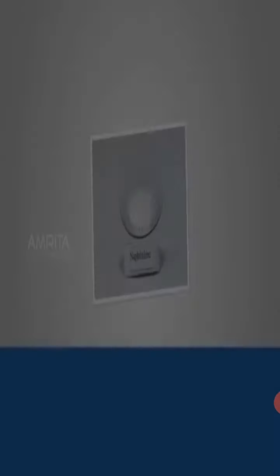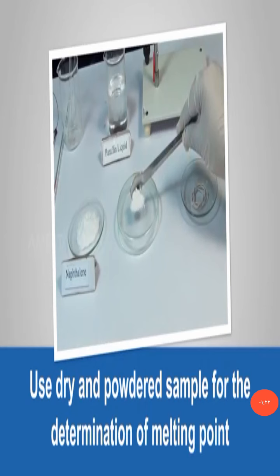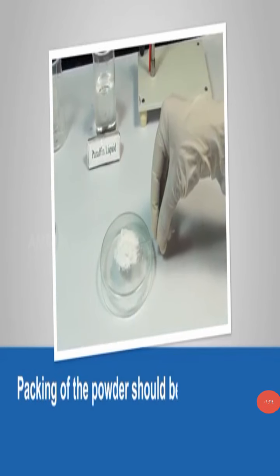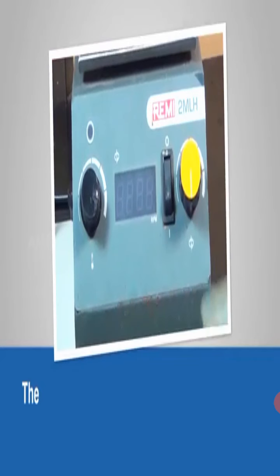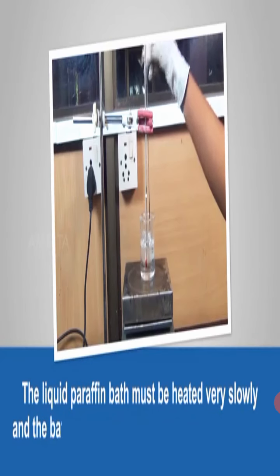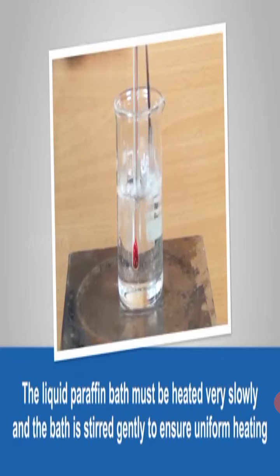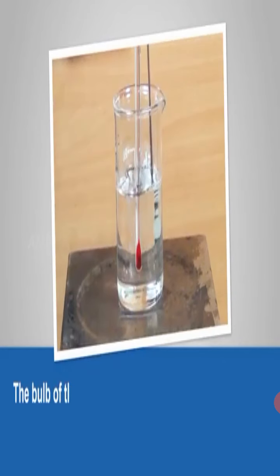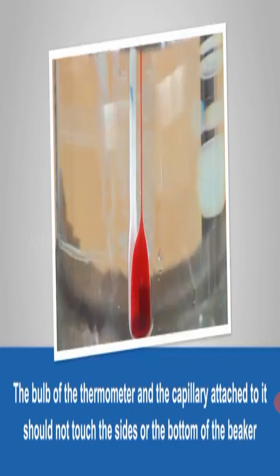Precautions. Use dry and powdered sample for the determination of melting point. Packing of the powder should be uniform without any big air gaps between the solid particles. The liquid paraffin bath must be heated very slowly and the bath is stirred gently to ensure uniform heating. The bulb of the thermometer and the capillary attached to it should not touch the sides or the bottom of the beaker.